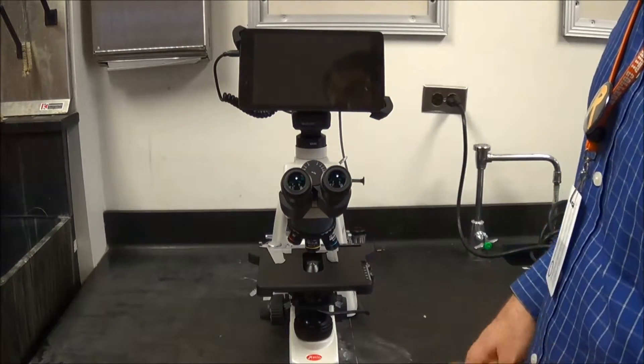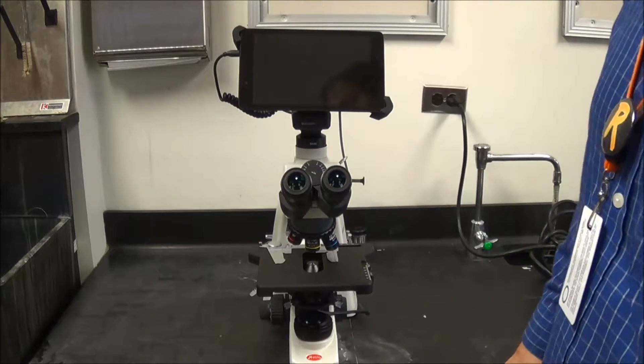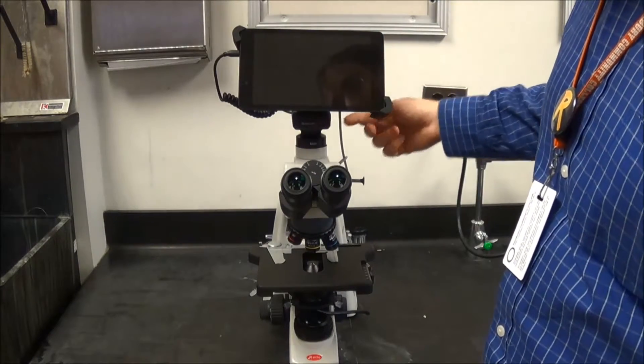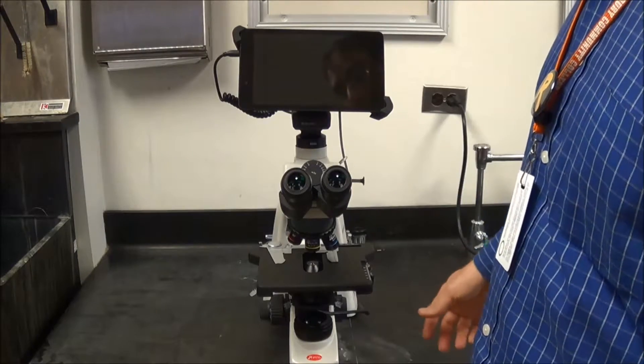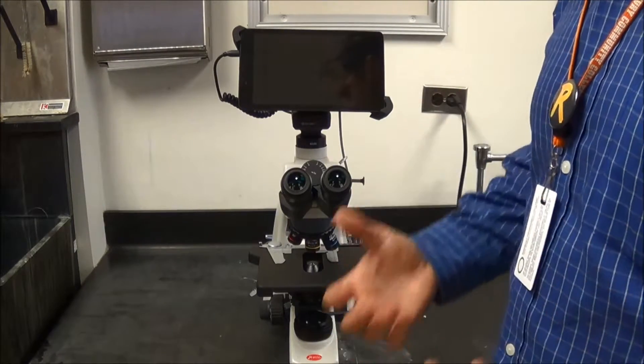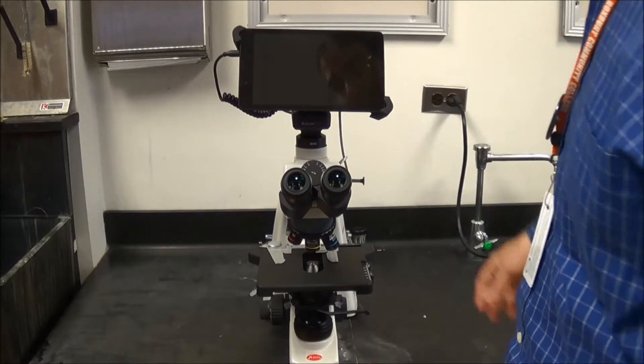When transporting this microscope, it's a little bit heavier than the old microscopes. Obviously, it has the added weight of the camera and the tablet. But in addition to that, this is a bit heftier than some of the microscopes we had previously.